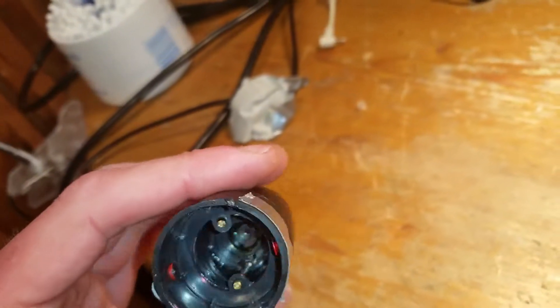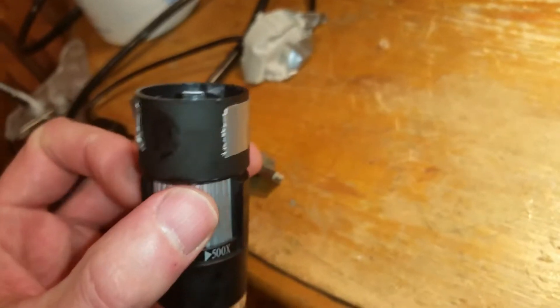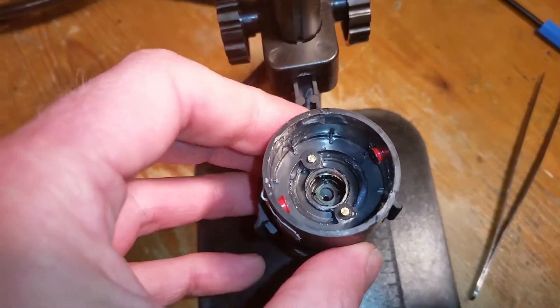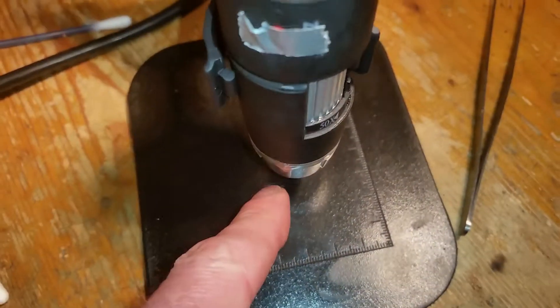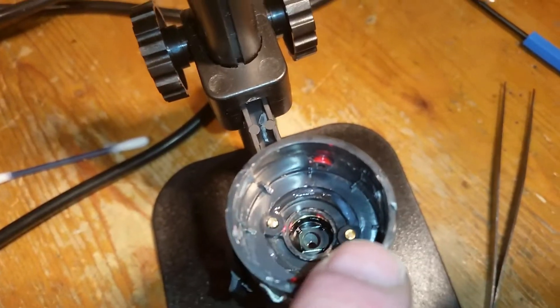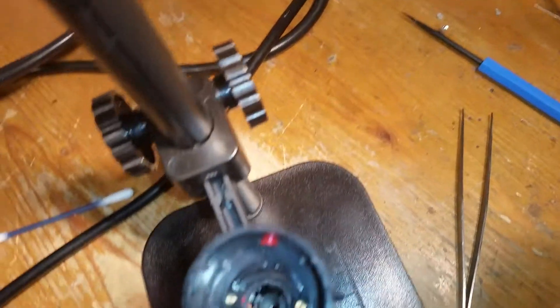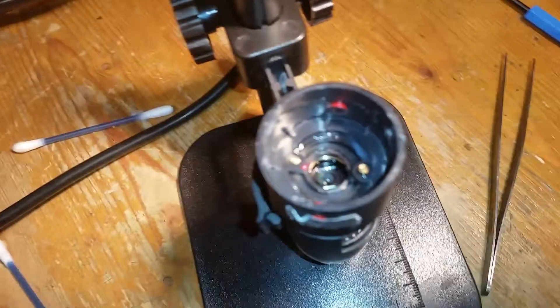Just get the photo cell back in there and put the back on it and it should all work. Camera working. It dawns on me why these contacts are metal - it's so cheap - and it's because they're powering the LED. I've broken them off when I've opened it, so I'm going to blob solder on top. Put the camera down and then blob - time to flow the solder through and open it, see how that goes.